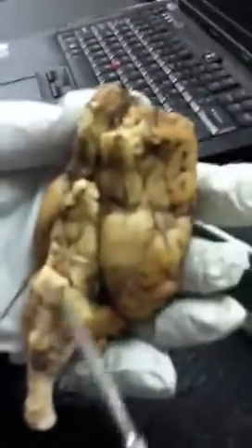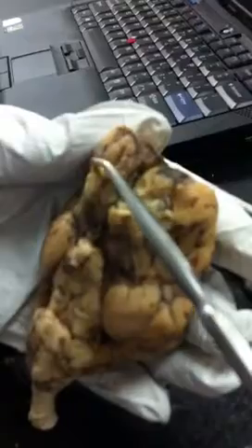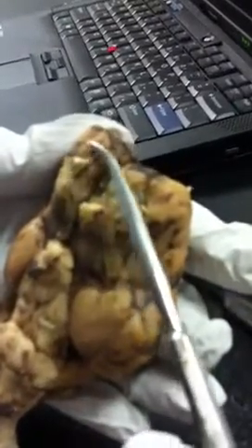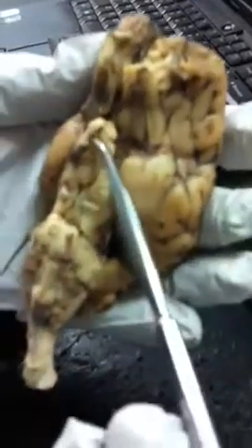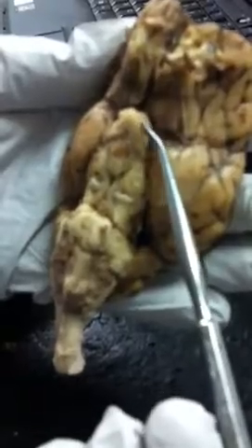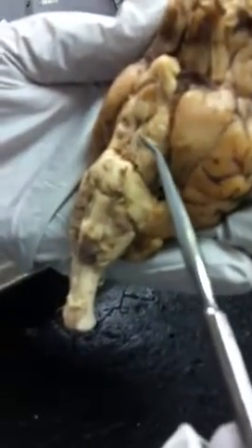Okay, so here we have the ventral part of the brain. You really can't see it here, but this would be the olfactory. The olfactory bulb, and this would be the olfactory tract. This right here, although it's cut off, that's the optic chiasma. This right here will be the optic nerve, and it's the optic tract.